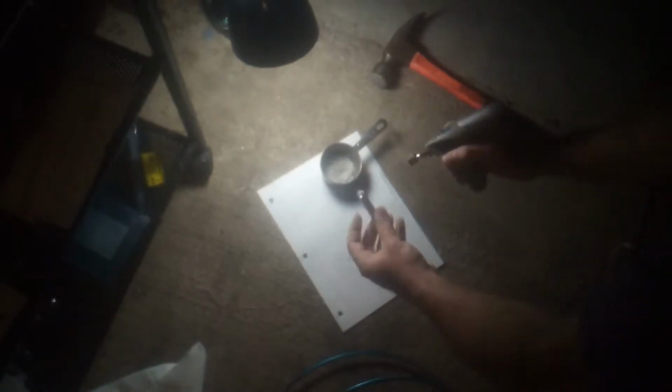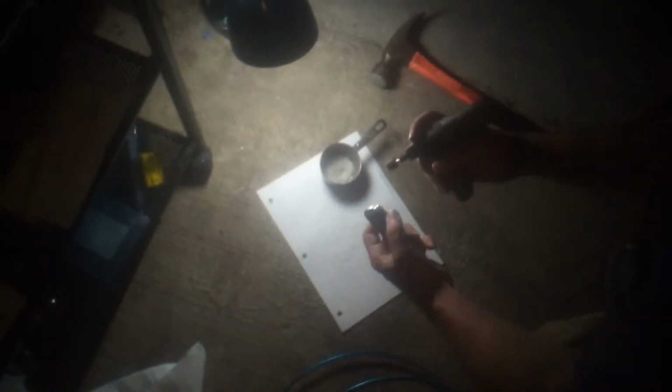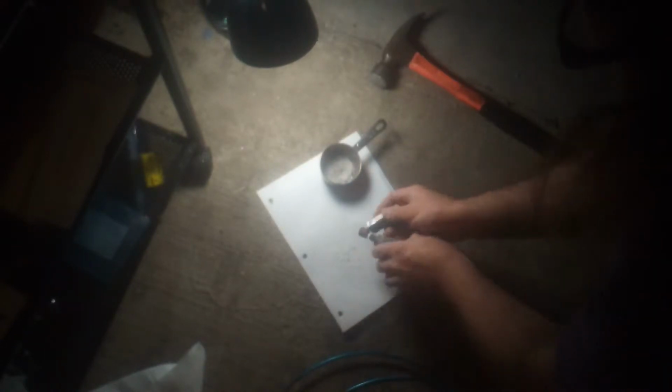This next step is really tedious. Grinding this magnesium block into magnesium powder with a Dremel. So here's the first batch of magnesium powder. And I figure I'm probably going to need at least twice this much. So that gets mixed in with the boron trioxide. And I'll be back when I have the rest of this. Okay, I think I should have enough now. So there's the thermite mixture.